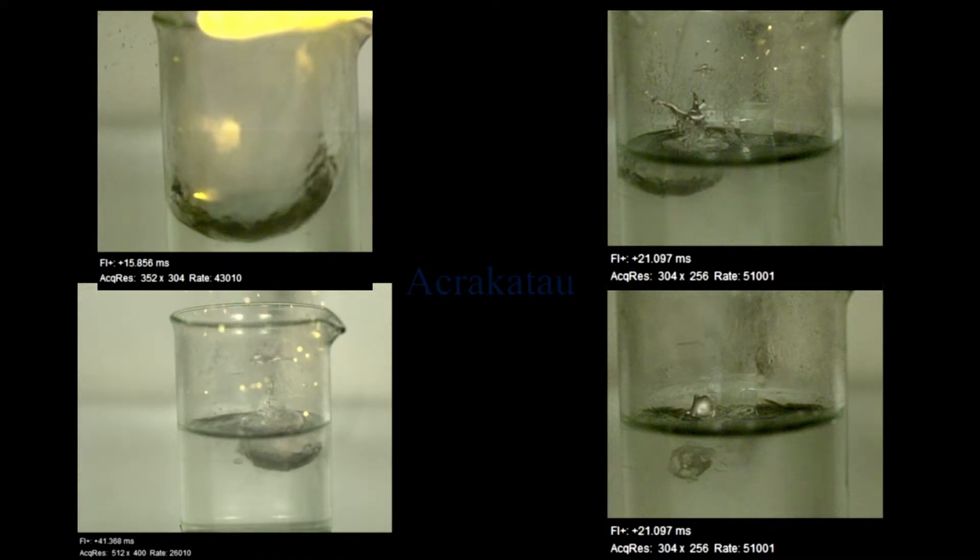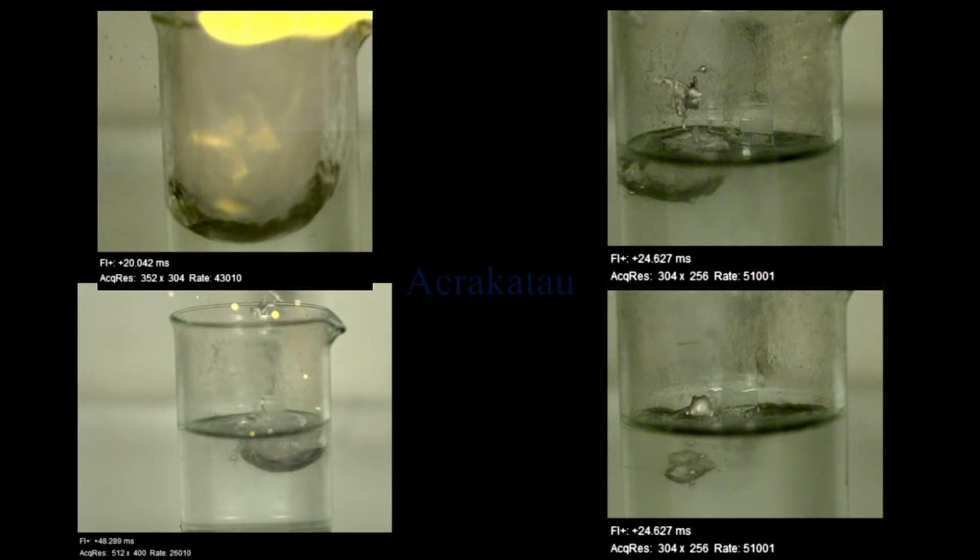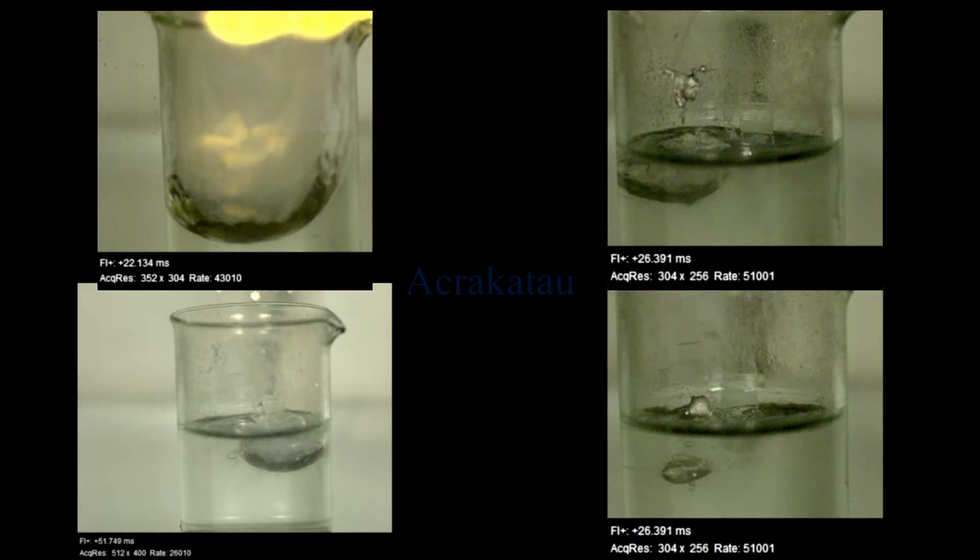In the lower right here it reacts very smoothly and only forms a little bubble. And the sodium doesn't really explode. And then the other two react about the same way.